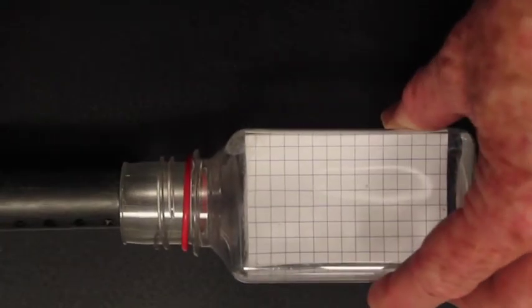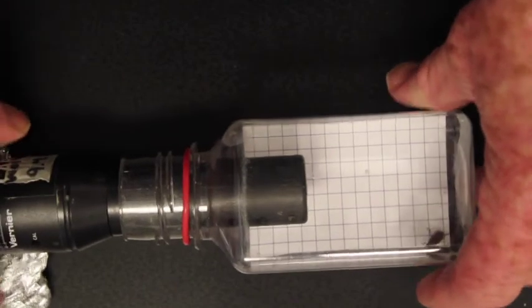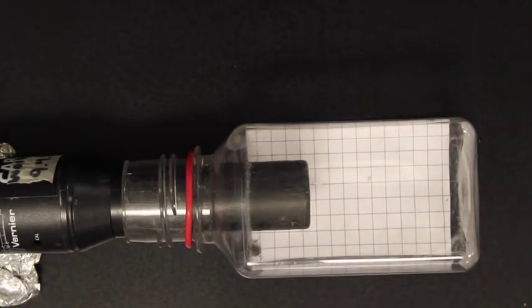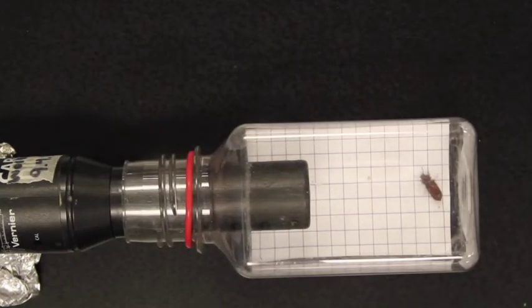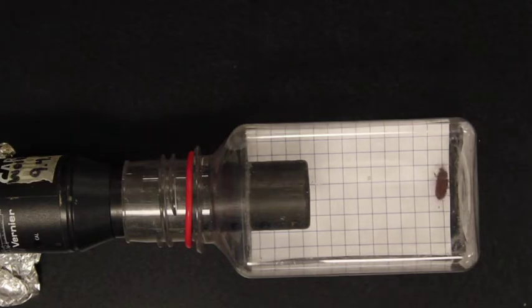So I'll attach the CO2 gas probe to it, make sure that it's nice and level on there. Okay. And then it's pretty good, if the beetle goes directly underneath that, then that'll be a problem. But we'll go ahead and acclimate it and then get this started. And I'm going to start this right here. We'll press play, erase, and continue. And our experiment is on.